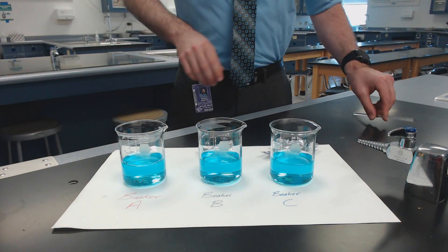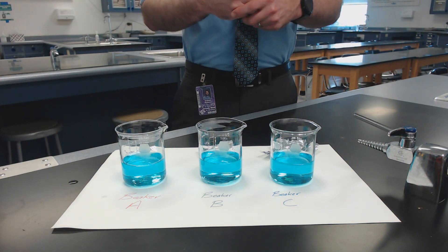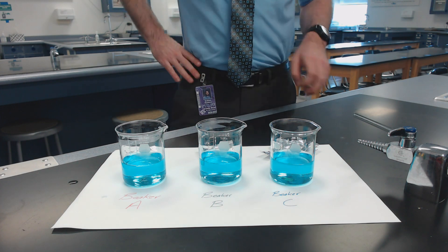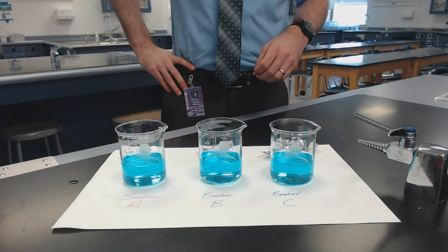So although the amount of copper chloride that we mixed with the water is consistent among each beaker, the amount of aluminum foil that's going to be added is different.